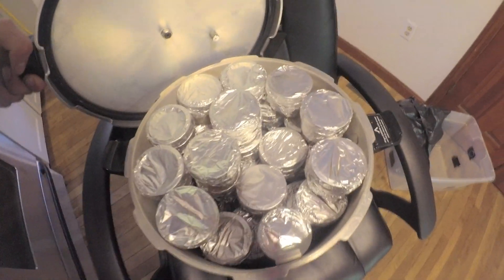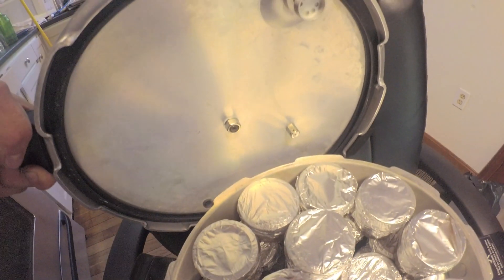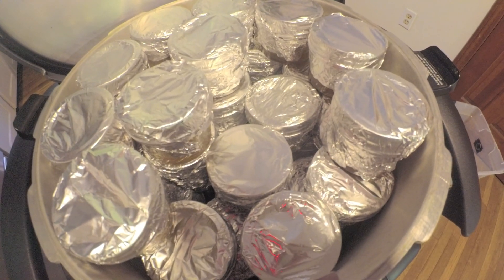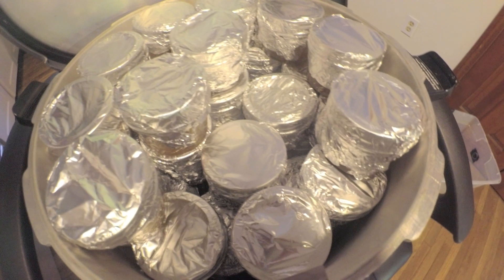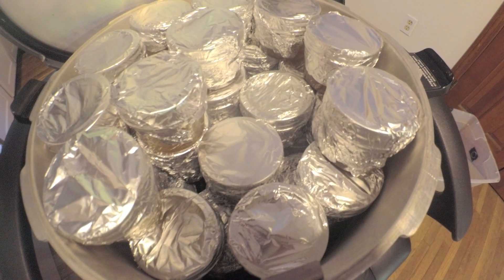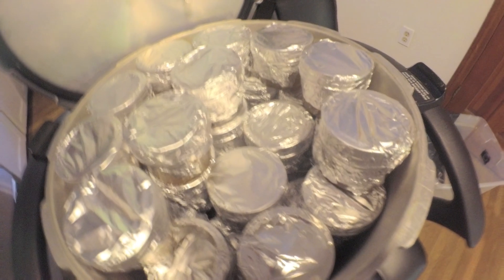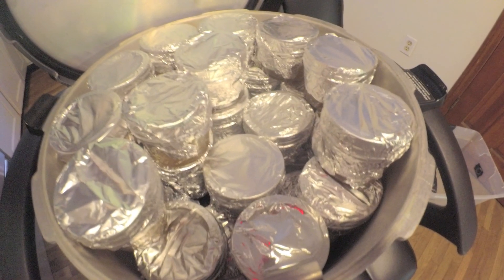You can fit like a whole tray of them, as long as you leave the valves and everything open. If you're pressure cooking with grain jars, just do it for however long you do that — 90 minutes. And if you're doing only agar, you can get away with going for like an hour, maybe 45 minutes, because liquids sterilize a lot faster than solids.